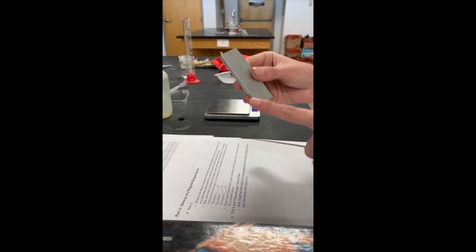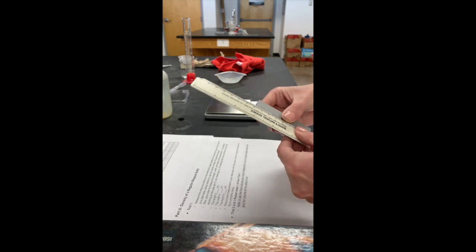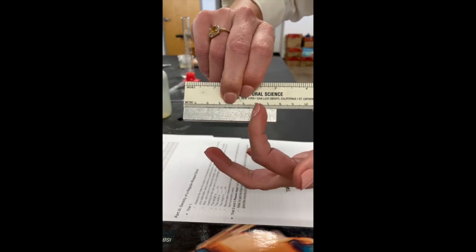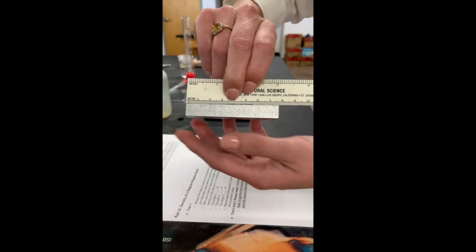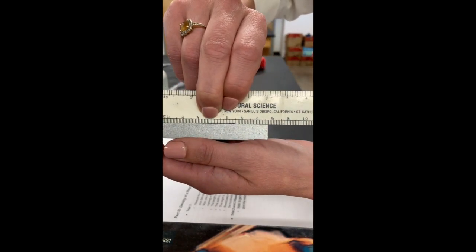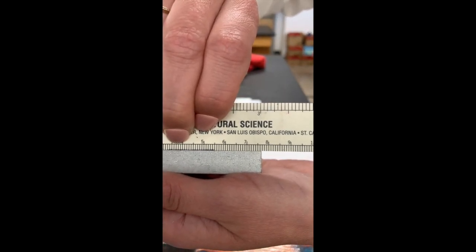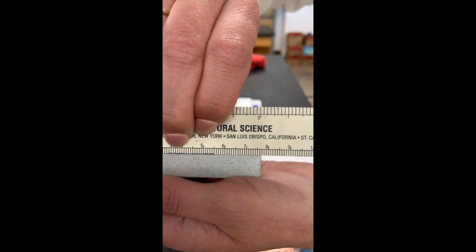Now we're going to measure the length, width, and height using centimeters. Here we have our ruler. We have inches and we have centimeters. Please make sure you're using the correct side, otherwise it will not get you the right answers. For the length, we're going to go with this longest part here. I'm going to hold it real close to the camera so hopefully you can see. Here we have 1, 2, 3, 4, 5, 6, 7, 8. Oh, not fully 8. So take a real close look at that, and please record that number. This is the length in centimeters.